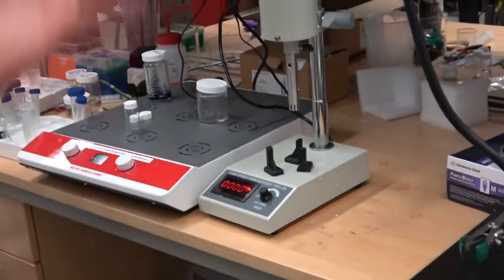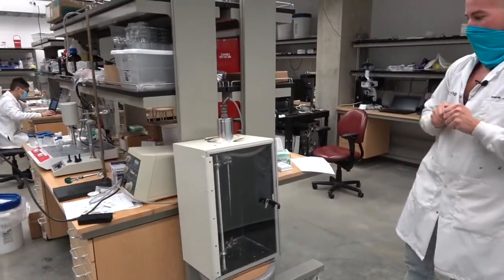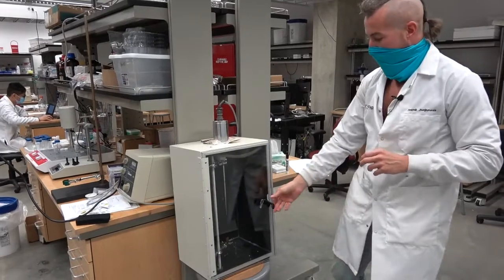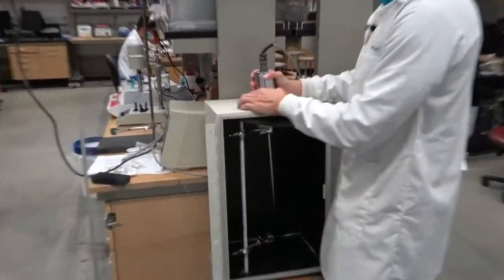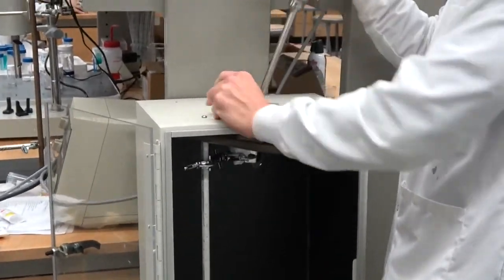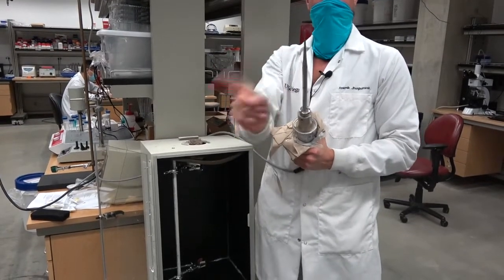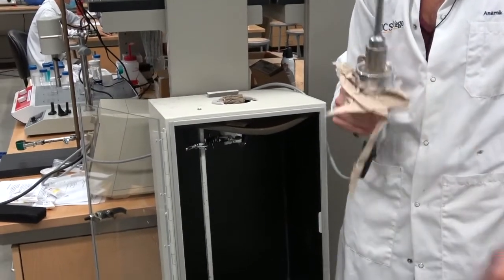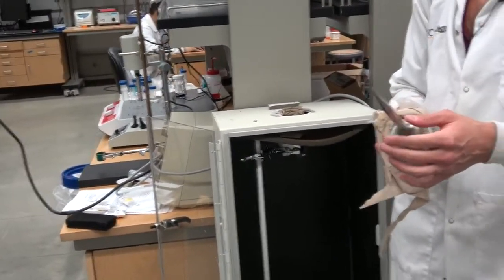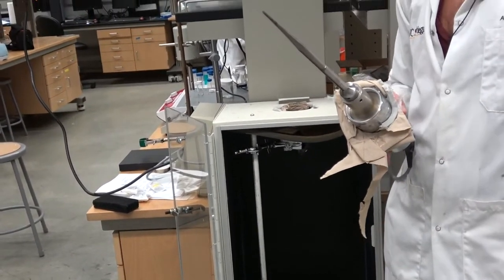So moving then to even further energy, we have this device. I'm having issues right now, that's why we're not using it. But this is basically like a glorified electric toothbrush, and it sits and wiggles really, really fast. It really is the same technology that's in a Sonicare toothbrush that vibrates junk off of your teeth.